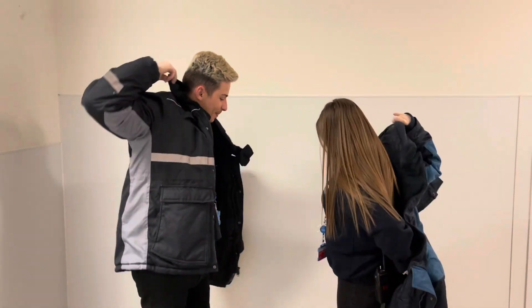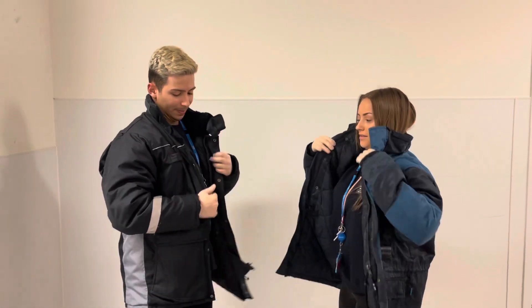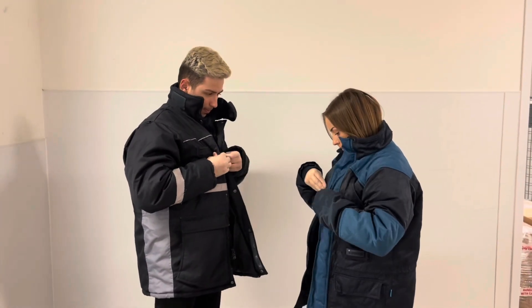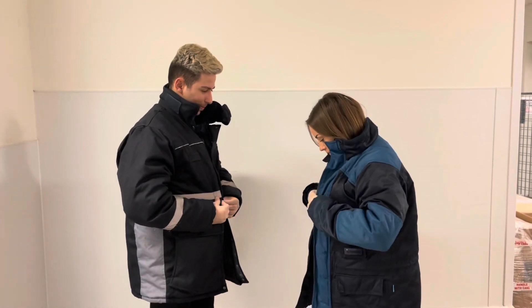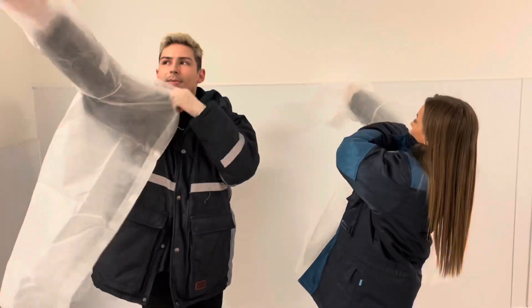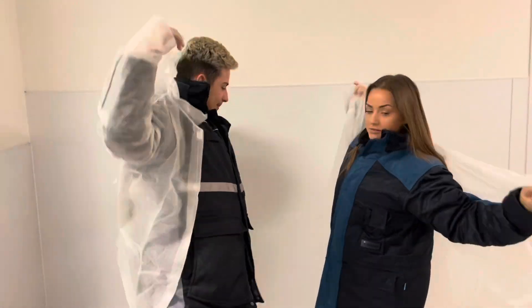Make sure you put on the PPE and jackets provided before entering the cold room, as it can be up to minus two. Once that's done, put the disposable lab coat on top and make sure it is done up properly.